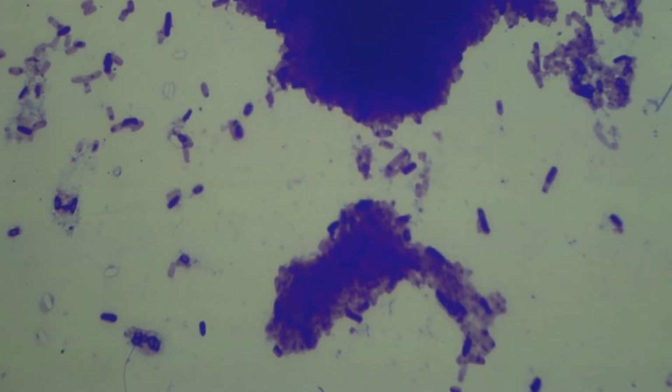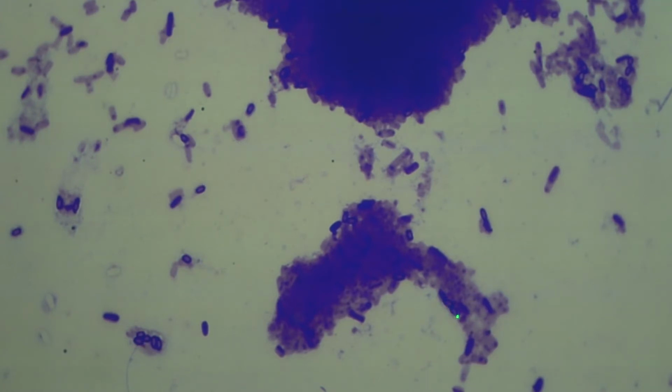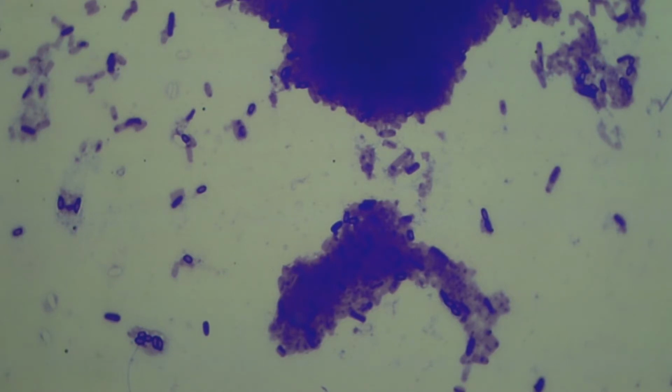And as Bacillus subtilis undergoes different environmental stresses, it begins to sporulate. In lecture, we will talk about spores, but I want you to look at this cell right here. Do you see how it's purple around the outer edges, but inside it's lavender? Here's an example here, here, here. These are egg-shaped spores. Over here at the bottom left of the screen, you see egg-shaped spores. Here's a spore. Not to be confused with the vegetative rod-shaped, thick sausage or hot dog-like cells.